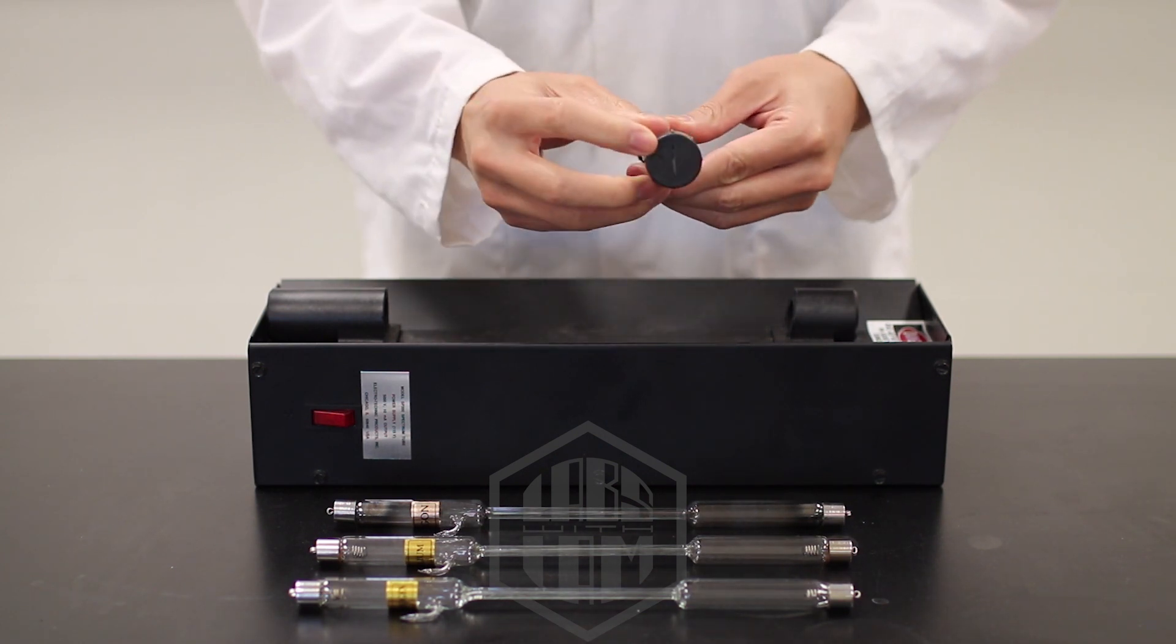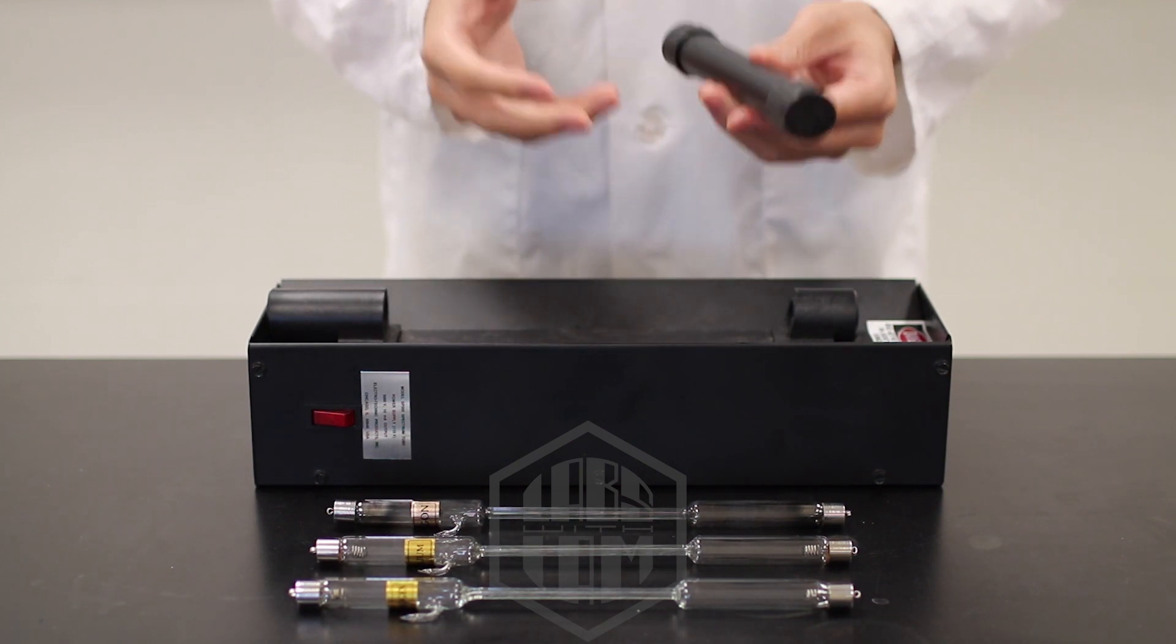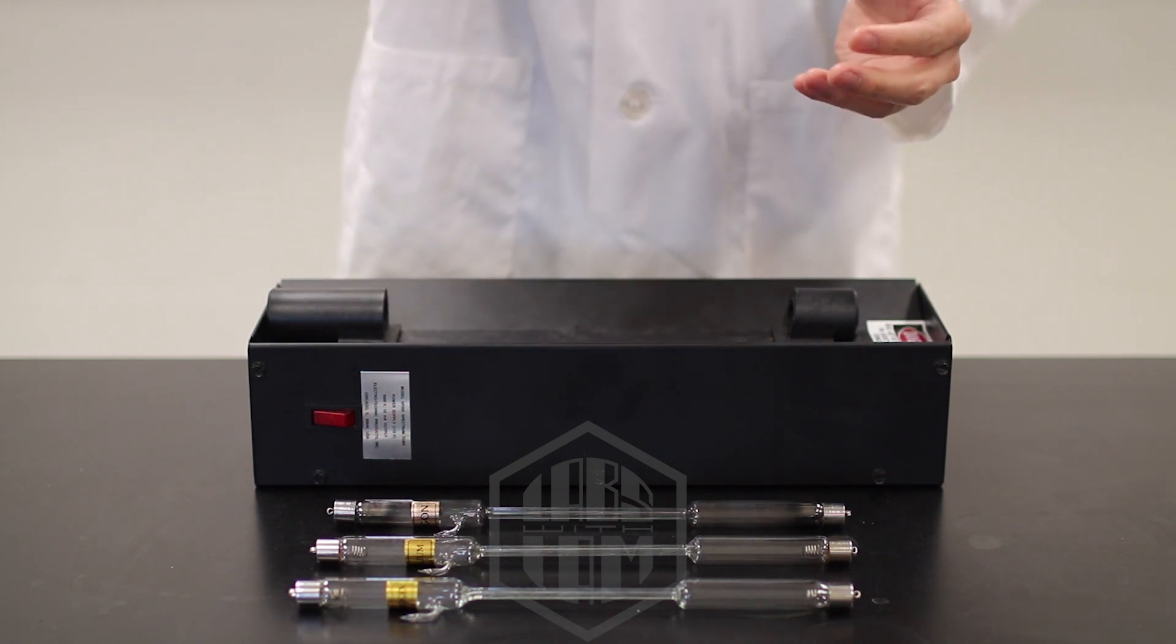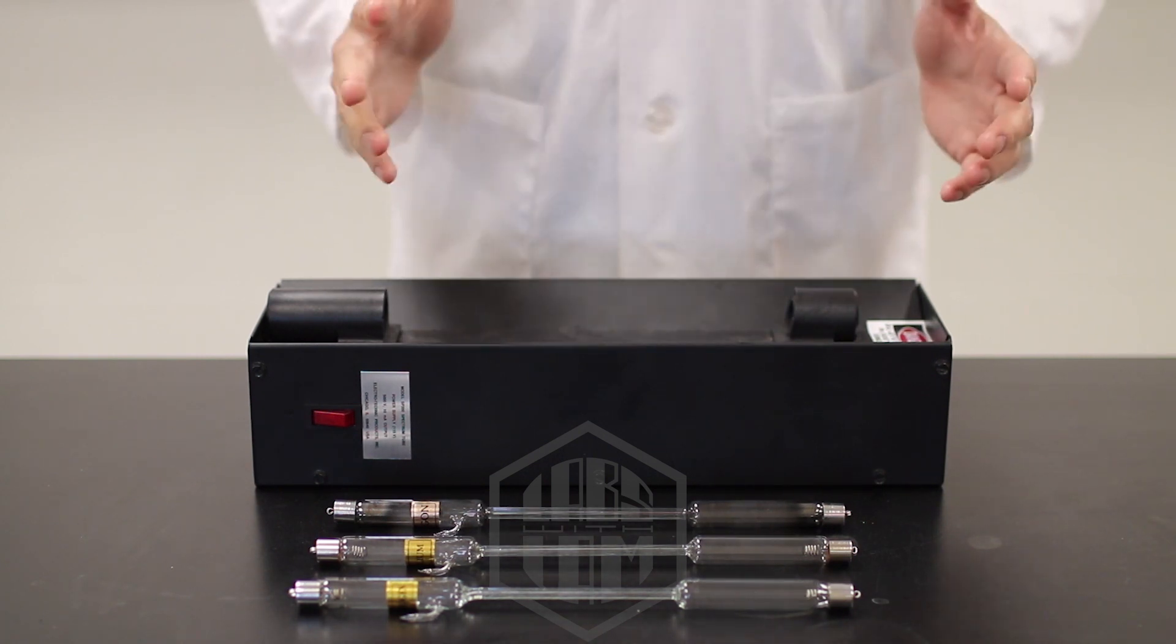On the other end, there's a single slit. This helps to limit and focus the amount of light entering the viewer. So I'm going to give this to you, but you can only use it when I tell you to, okay? Great.